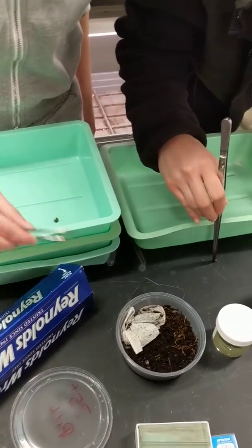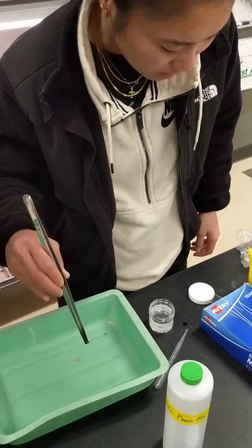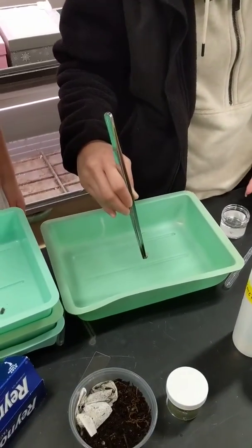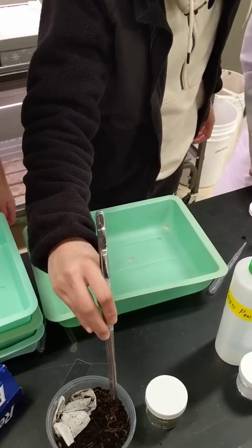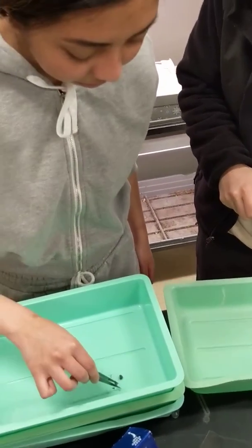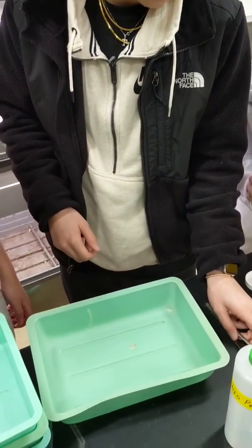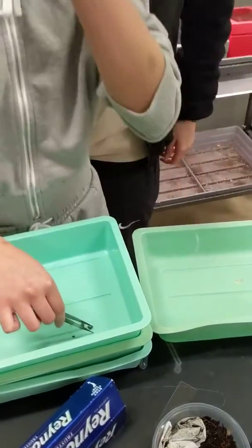Are you going to put some paper in there or whatever? What's your experiment going to be? Oh yeah, we have to line it with dry paper and then one that's wet. And then what are you going to do? See how they react to the environment. Okay. And then you'll count them a little bit later? Uh-huh.